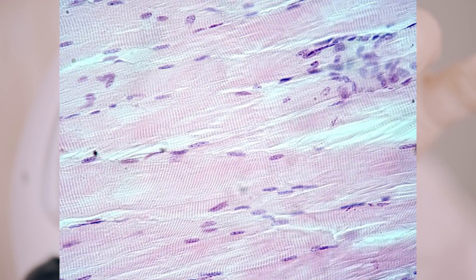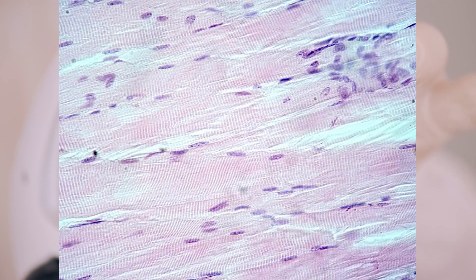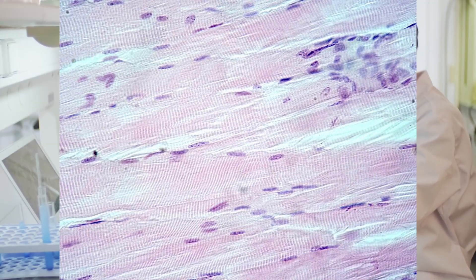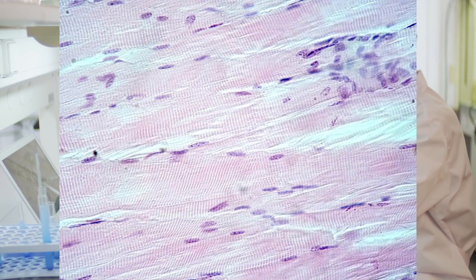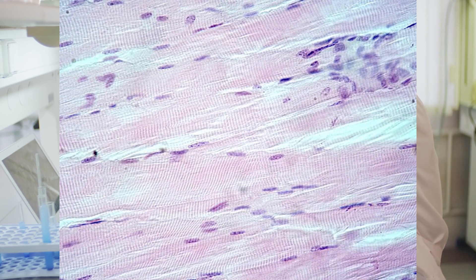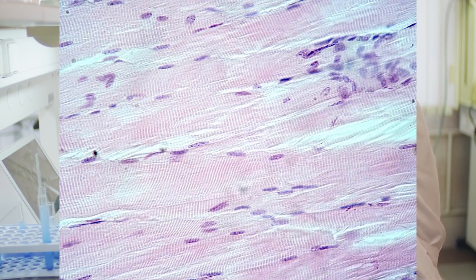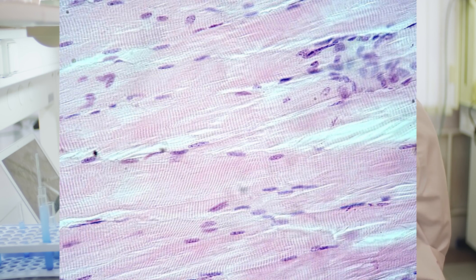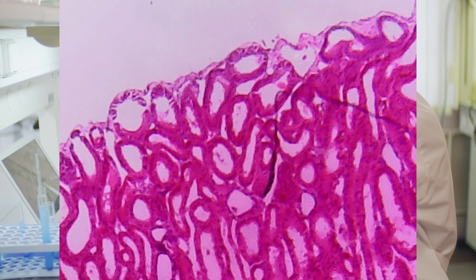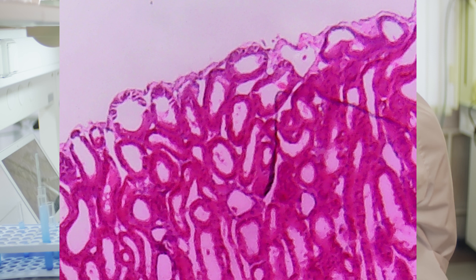Haematoxylin is also good for staining things like RNA in ribosomes and the endoplasmic reticulum. Eosin, by contrast, is somewhat more useful at staining basic structures. It is somewhat acidic, and this is why the two interact, causing a pinkish-reddish colour. The benefit of this is that cytoplasmic structures tend to be better stained in that environment.